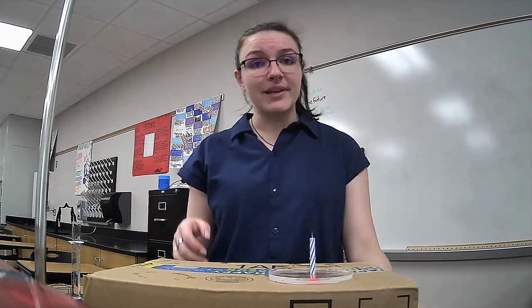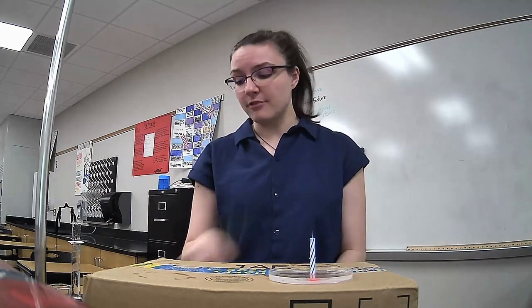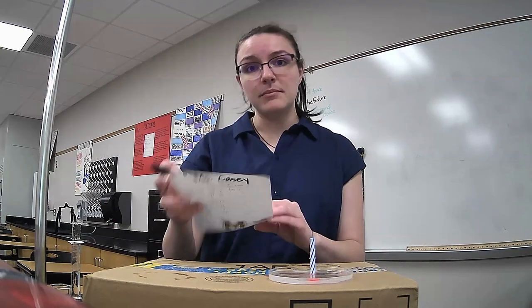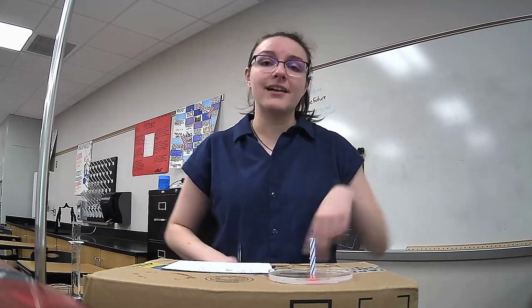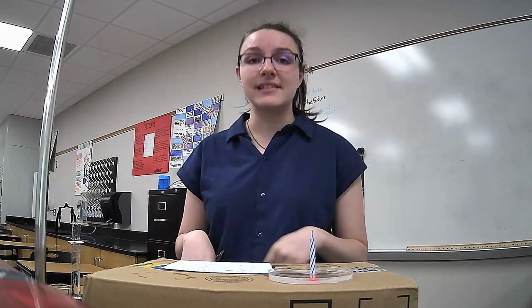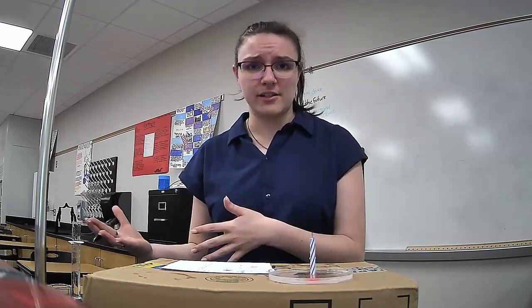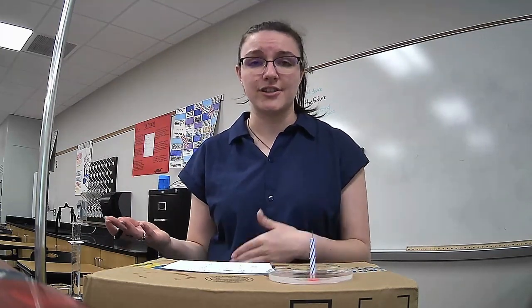Now I need to do some calculations. I know that in my first trial, the water rose by 16 milliliters. In my second trial, it was 15 milliliters. And in my third trial, it was 17 milliliters. I need to take that and turn it into oxygen, or a percent of oxygen.